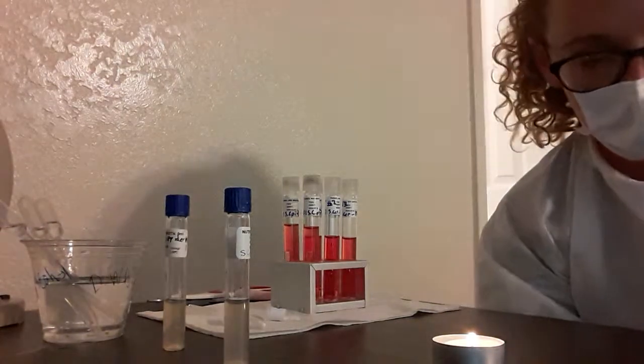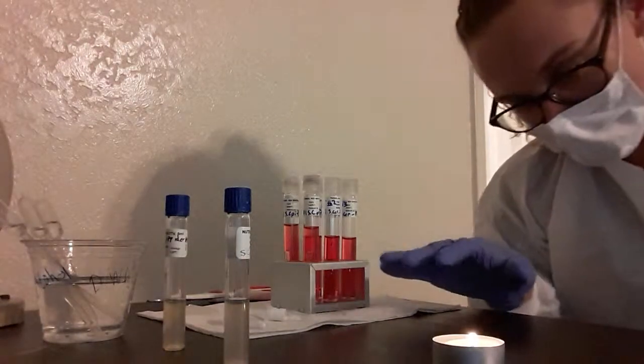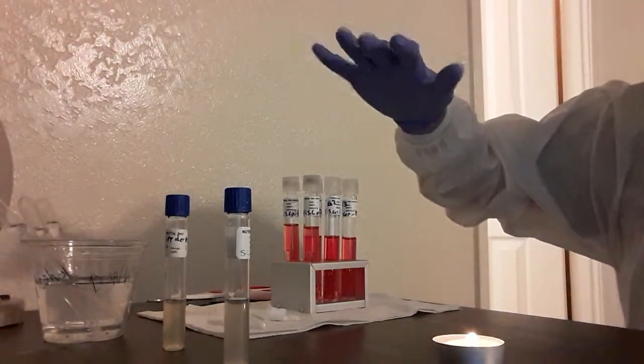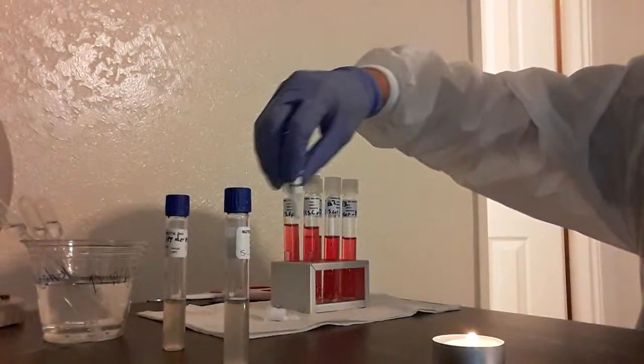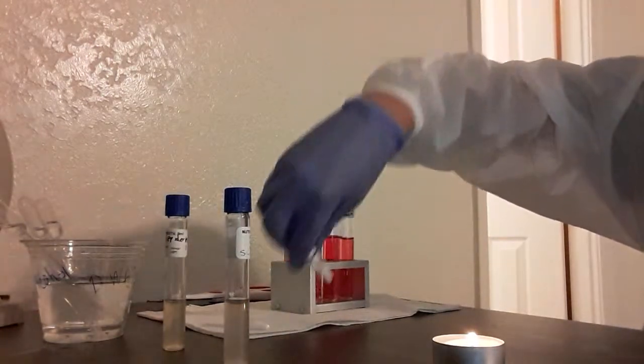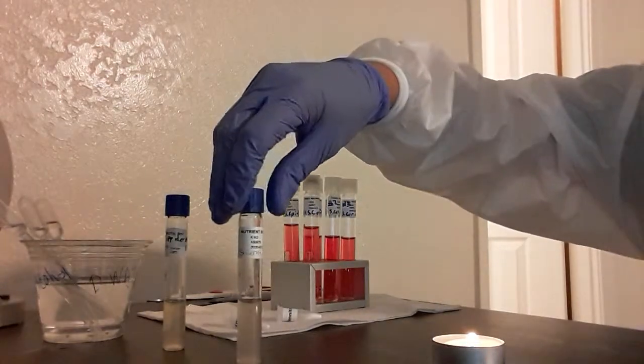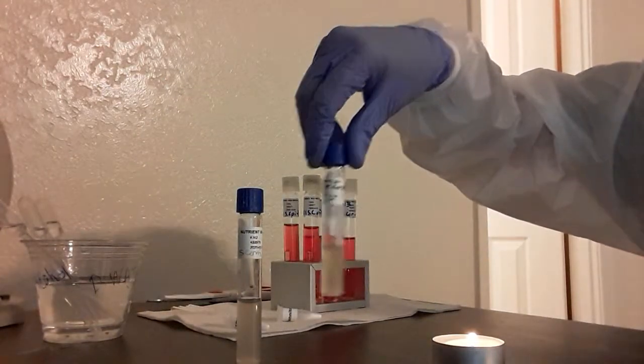and get them into specific groups. So for this assignment, we had to clean up our area and wear PPE, and I have my phenol red broth here. I had my glucose container, but now I have my fructose and my mannitol. I have my nutrient broth here, the S. cerevisiae, and I have my S. epidermidis here.